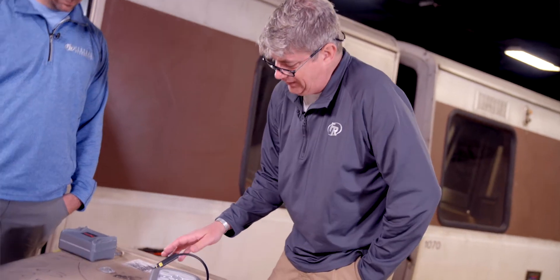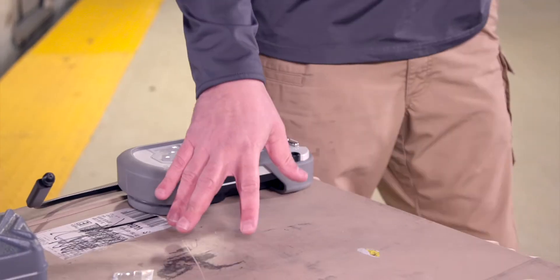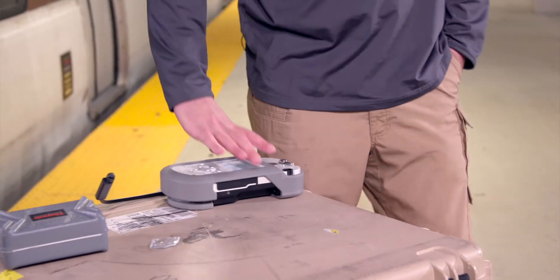You do want to wear safety glasses when you use these instruments, not so much for laser safety — it's because of something like that. If it does detonate, you don't want a burning particle to get in your eyeball. So there you have it: any unknown solid or powder, the first scan should be in point-and-shoot mode like you saw here. Once you eliminate the possibility that it's explosive, then you can go to vial mode. And with that, we'll wrap up this segment on safe sampling. Tune in next time and we'll cover some more safety or sampling tips with the Gemini.